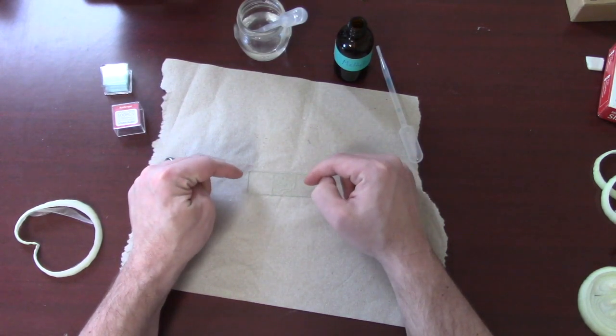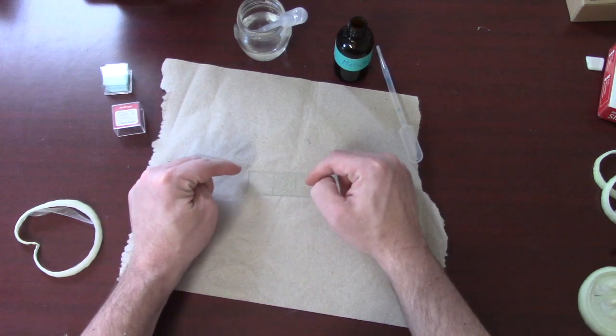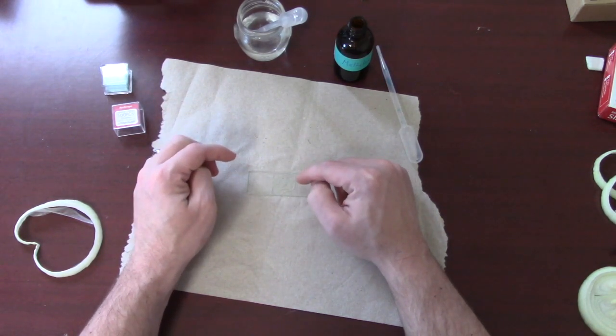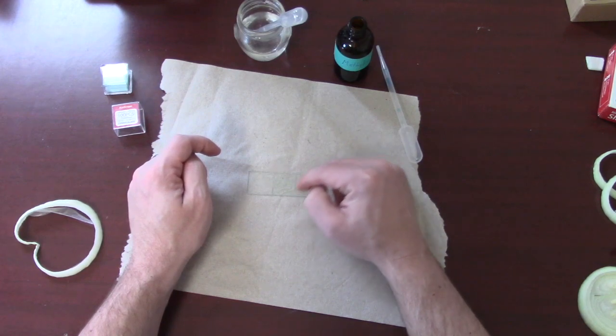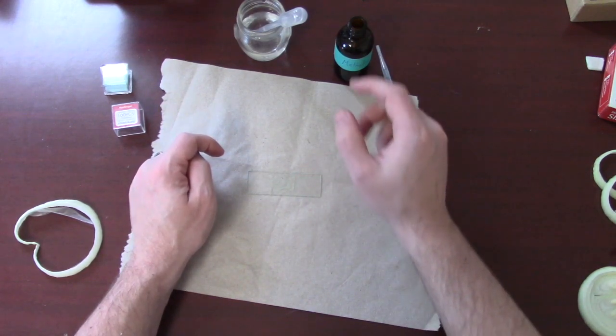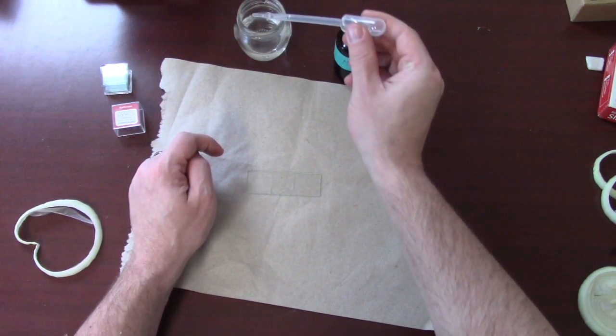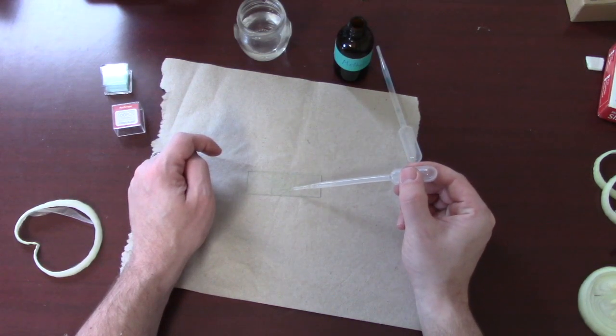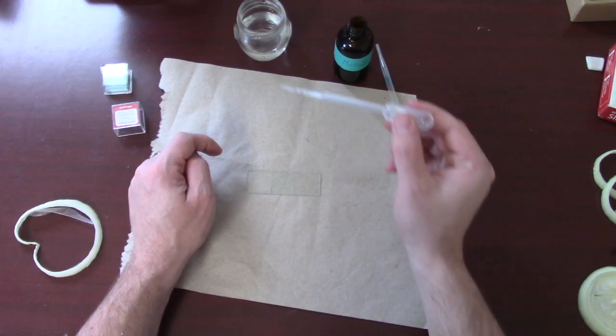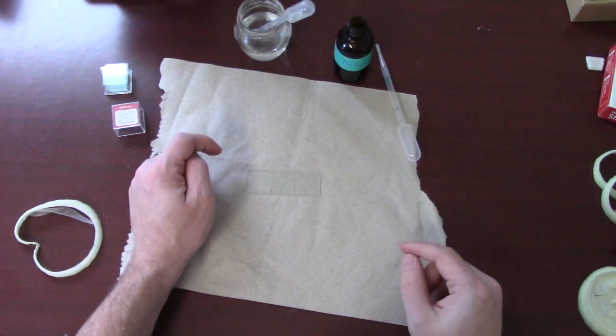Alright, and now what I'm doing is I'm taking a look at my microscope slide and I'm trying to see if I have any bubbles. And it looks like I have a little bubble right in the corner. Water is not filling up the whole thing. So, I'm just going to add a drop right to the edge of the cover slip. And that water gets sucked right under.